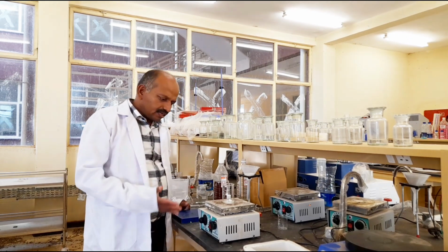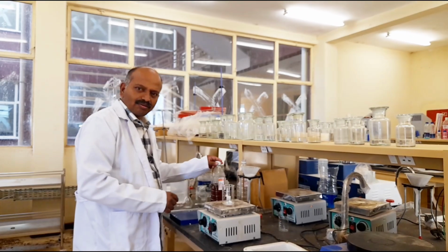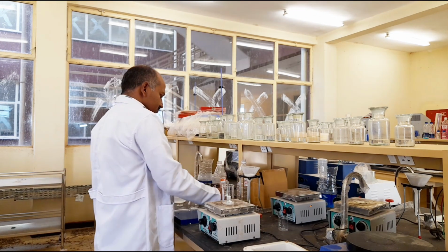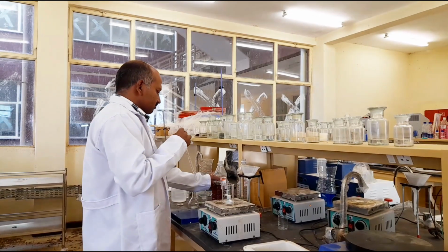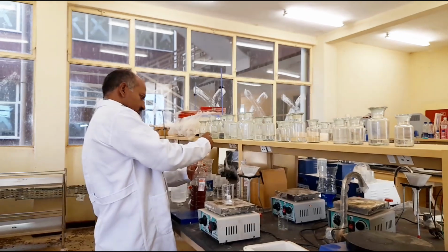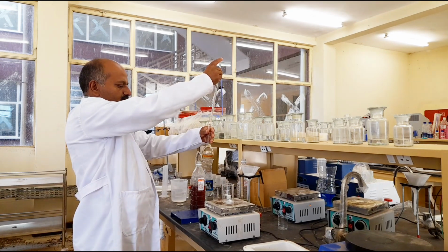Yes, this is the titration bench. Now we will perform the experiment. This is the wine sample. So now I will take 10 ml of this raw wine sample into the volumetric flask, which is 100 ml capacity. I will pipette out the 10 ml of the wine sample with the pipette. It is an already washed pipette. Yes, this is 10 ml of the wine sample. I am taking it to the volumetric flask.